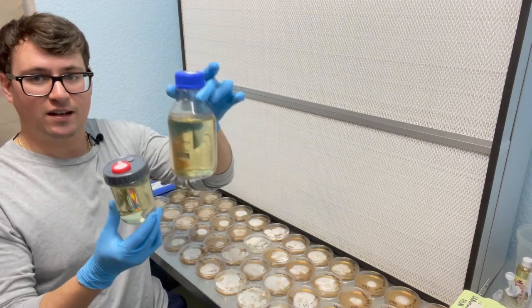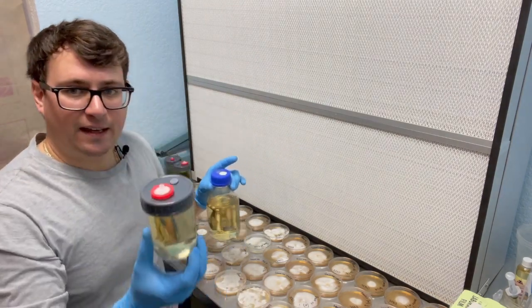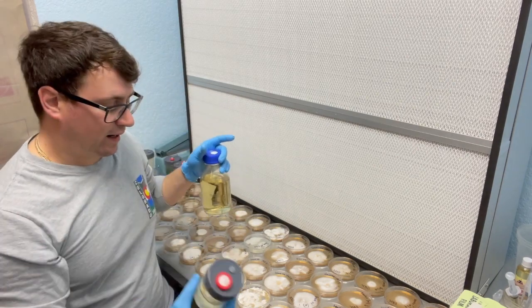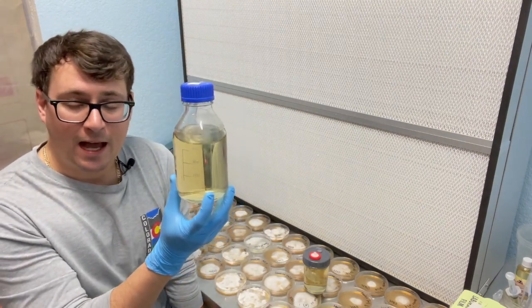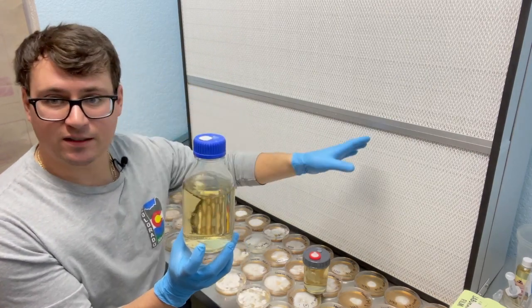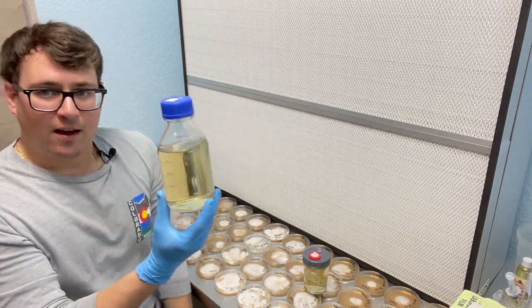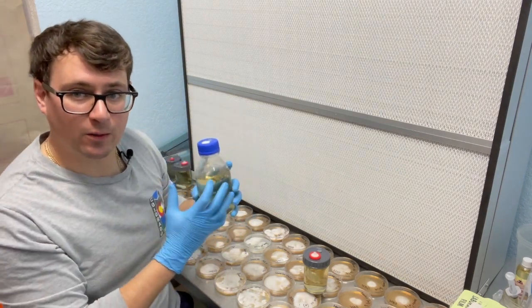First I wanted to show two different types of liquid culture bottles I like to use. You can get these tiny little jars, and that way if you're testing out multiple different varieties it's not taking up a ton of space. You can grow out a pretty substantial amount of mycelium in a tiny little jar. I've also got a media extractor bottle here without the hose — I'll sterilize those separately and just keep a regular cap on while doing inoculations because the other attachments can get in the way.